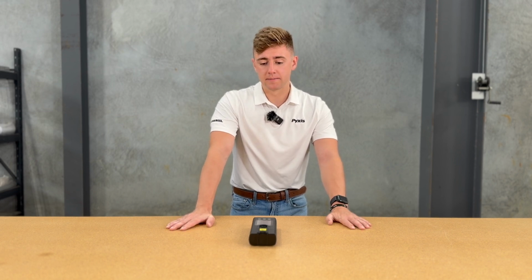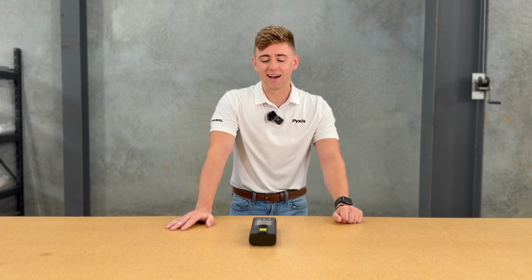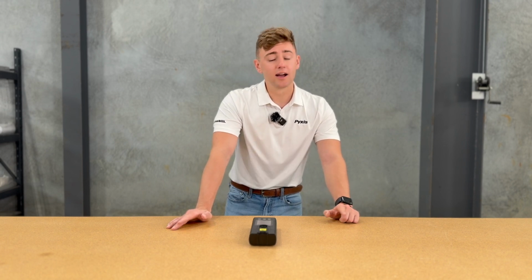If you guys have any questions on this or need any help, you can always call our service team, but use this video as a nice guide to show you guys how to connect quickly and how to exchange that battery on the SP710.